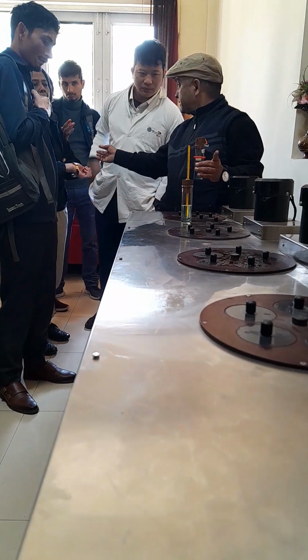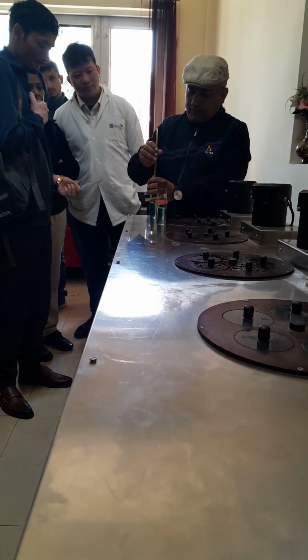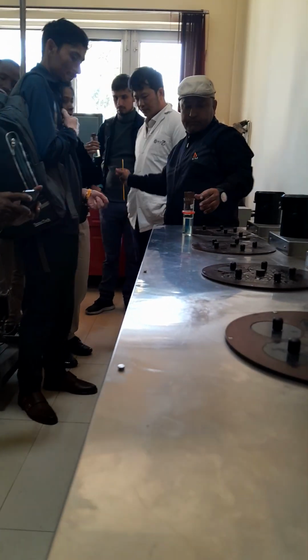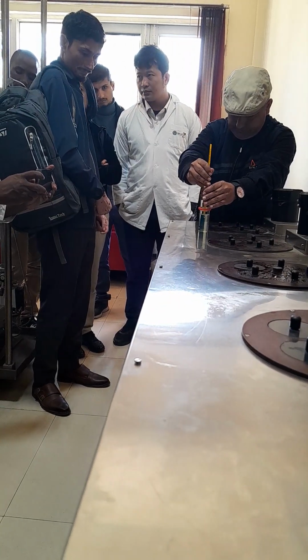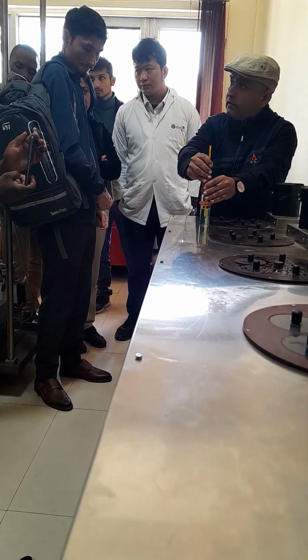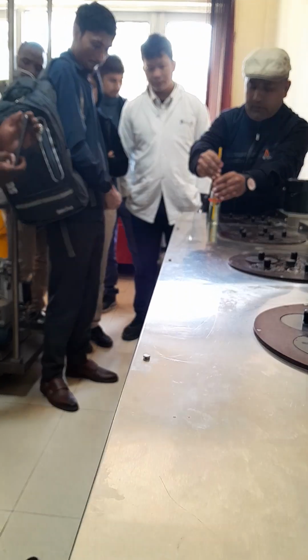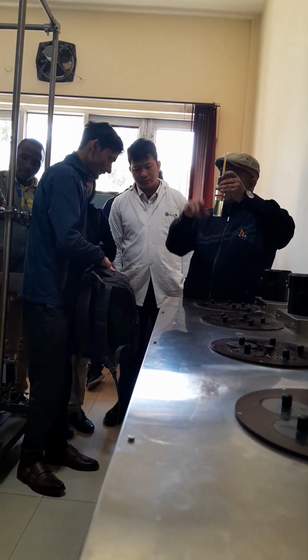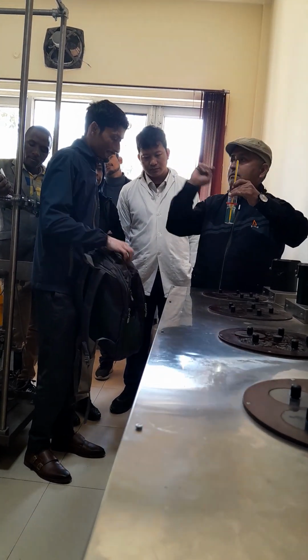Thermometer is okay? Different color? No, same sample is there. Sir, in the ASTM procedure, you mentioned that we will add 3 degrees. Yes, in pour point cases. Right now you are doing cloud point. Only difference is that when you are doing the cloud point, your thermometer will be at rest, and when you are doing the pour point, lift it up. It has to be deep inside the sample. Clear.